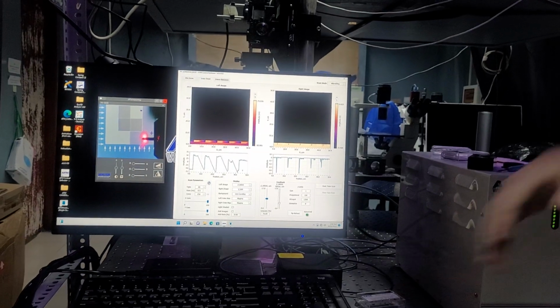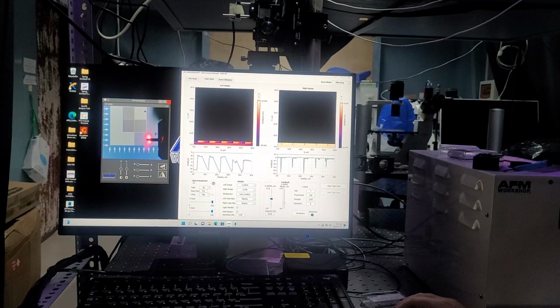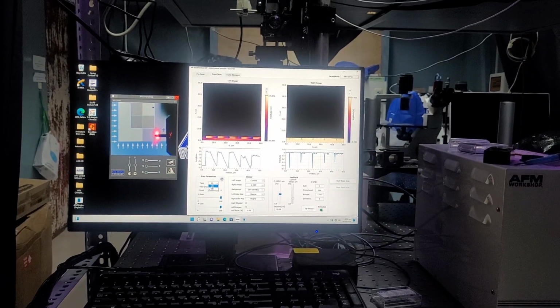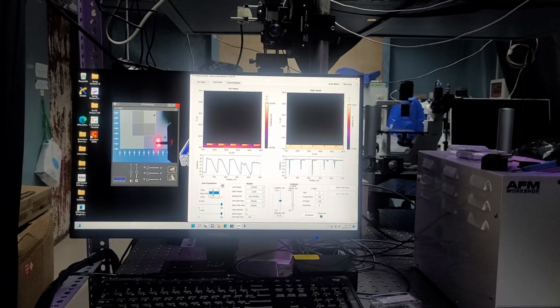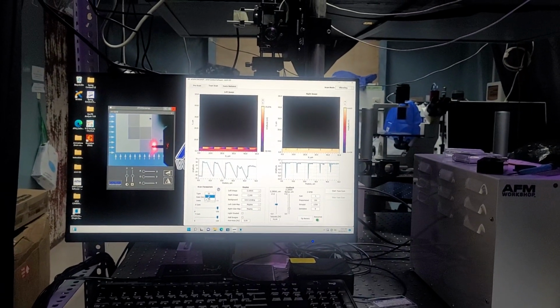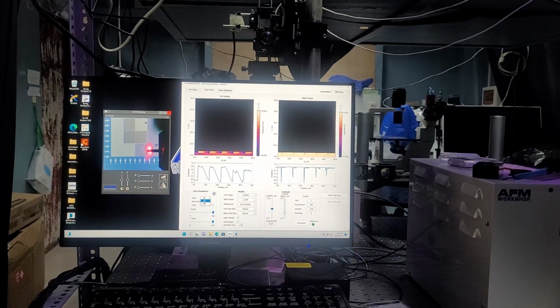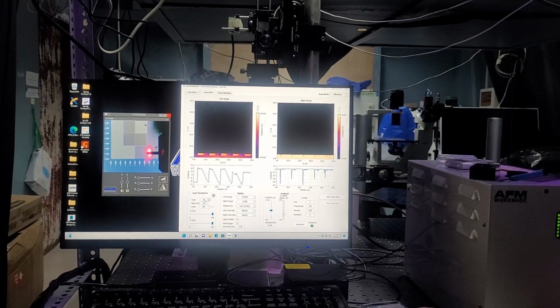So now, we'll go over the TopoScan window. So on the left, we have our scan parameters. You have the ability to change between a 2D and 3D scan. I recommend just keeping it on 3D. 2D will give you the X and Y data, but will not give you the Z data. So that kind of defeats the purpose of AFM. So I recommend just leaving that on 3D.